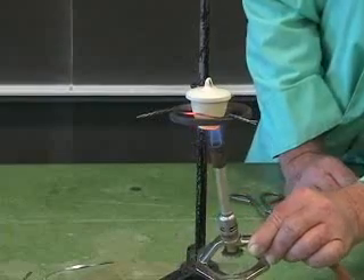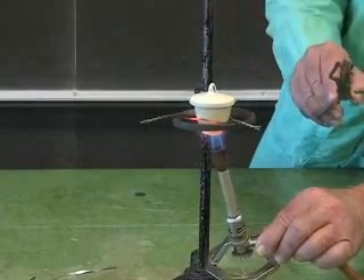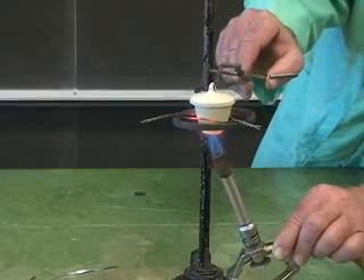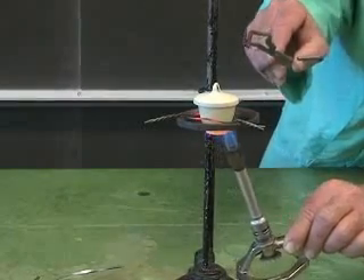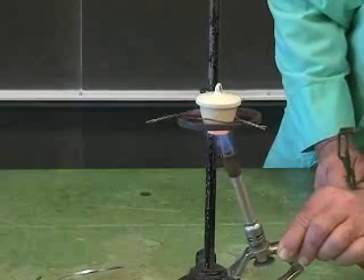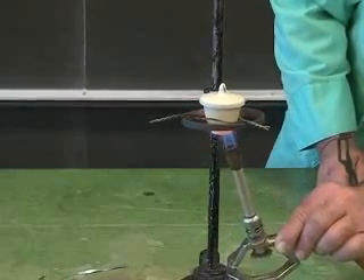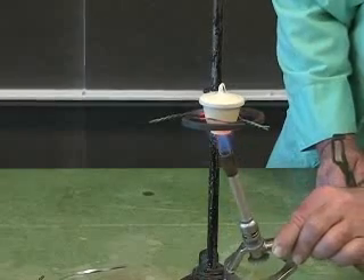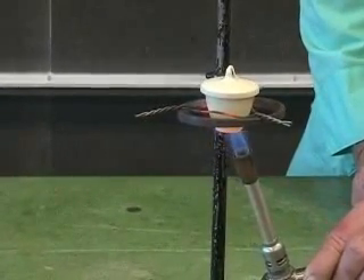Now I want to let a little bit more air into this reaction, because I know that with a closed lid there might not be enough oxygen to react all the magnesium. So I'm just going to lift the lid very quickly — I don't want to let any of the smoke or oxide escape the crucible if I can help it, but I've got to crack the lid a little bit. You might even see a little puff of smoke come out. That smoke was actually some magnesium oxide that escaped — it's unavoidable, but there's a compromise between making sure there's enough air and losing a little bit of the product. It is reacting in there — that's a good sign.